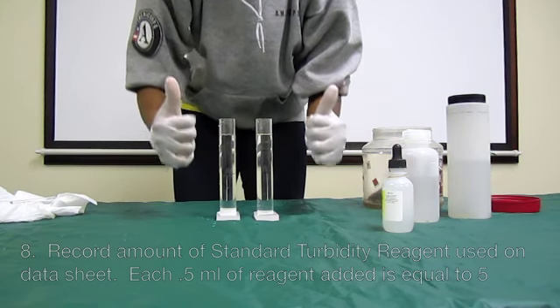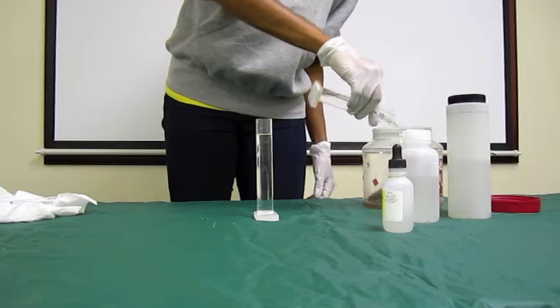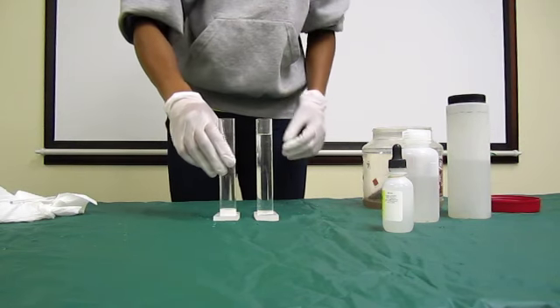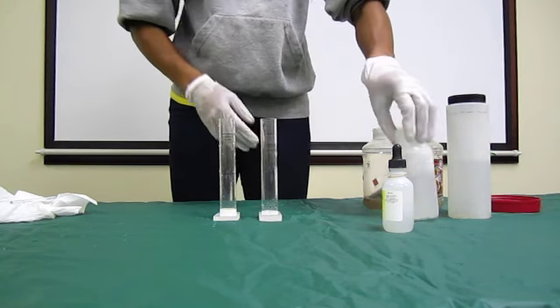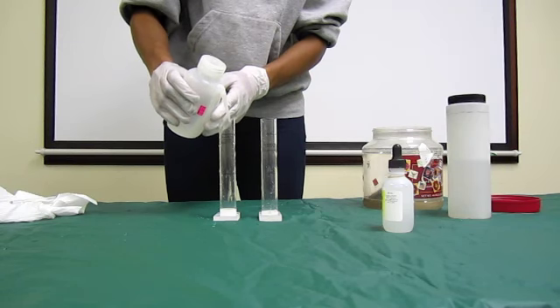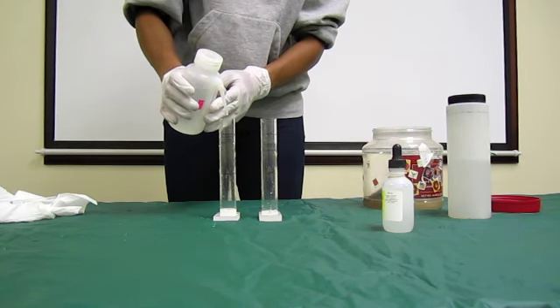Record the amount of standard turbidity reagent used on the data sheet. Each 0.5 milliliters of reagent added to the 50 milliliter sample is equal to 5 Jackson turbidity units. Remember to multiply the number of droppers added by 5 to obtain your score.